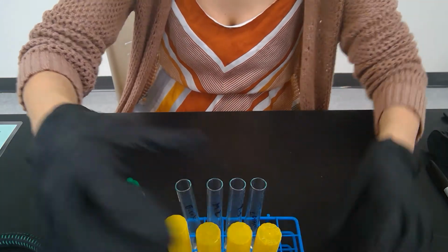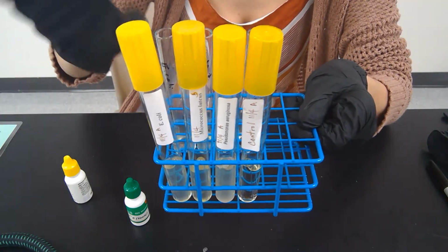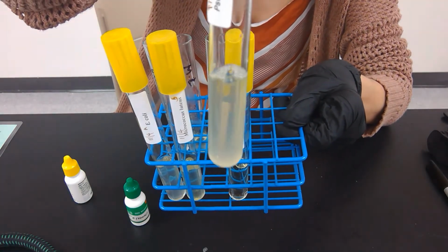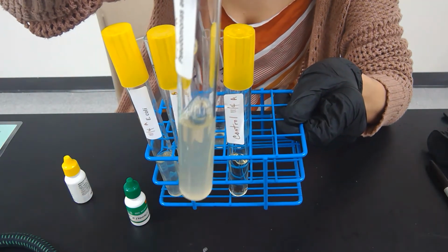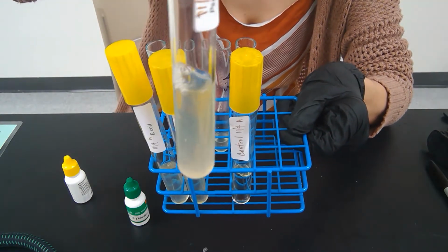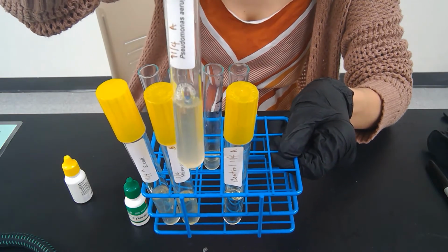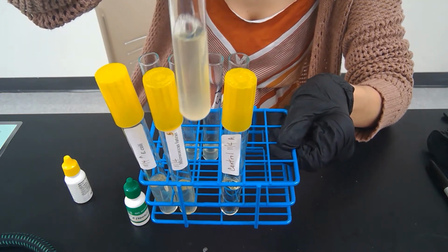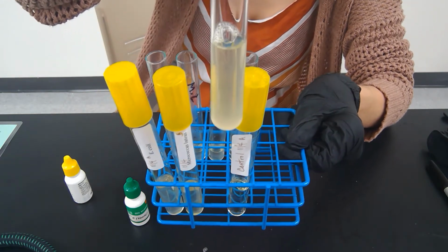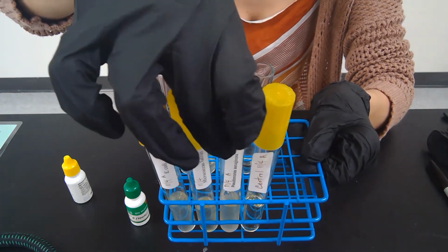So something else that you'll notice about the nitrate test is there is a small indication, but there is an indication for Pseudomonas aeruginosa having these bubbles on top. I don't know if you can see that, but it has these bubbles that are formed after it grew. And that's an indication that some sort of gas was formed, and it is likely the nitrogen gas. So this one should be a positive for nitrate reduction. So it took that NO3 and reduced it until it made N2 as nitrogen gas, and then it came out as little bubbles. So that's the one that you know is positive, and we'll see the result.